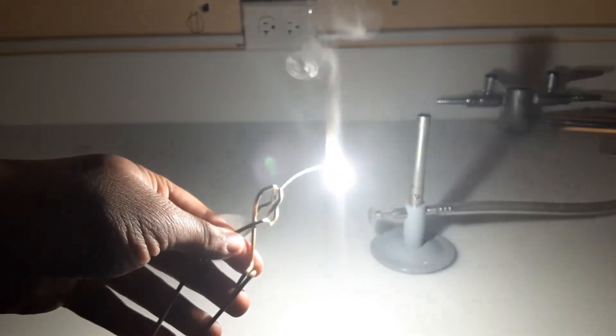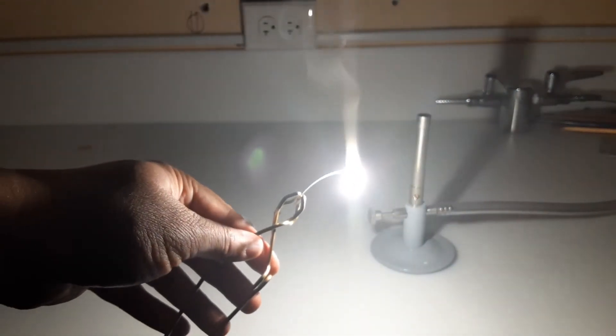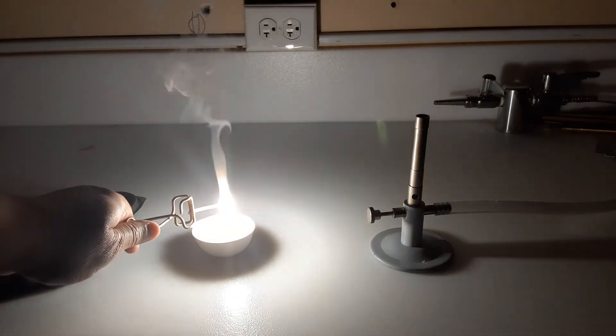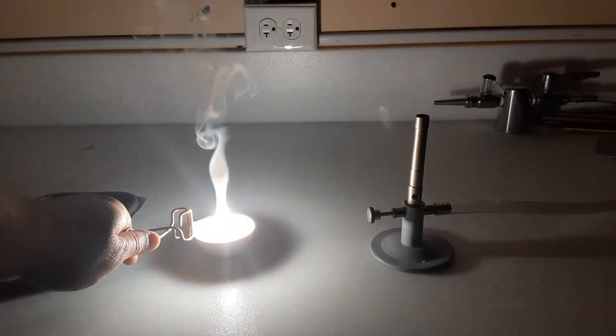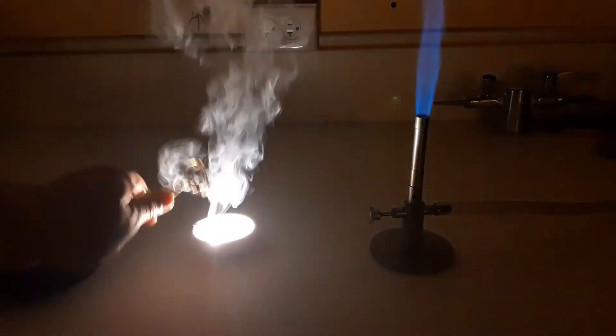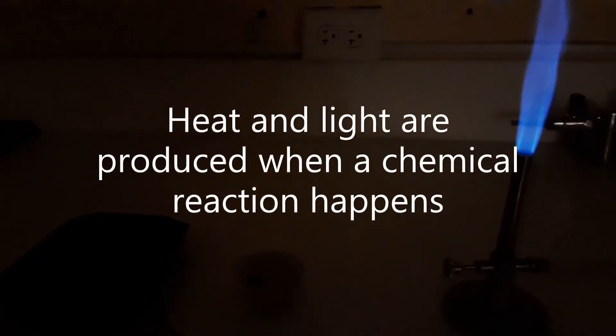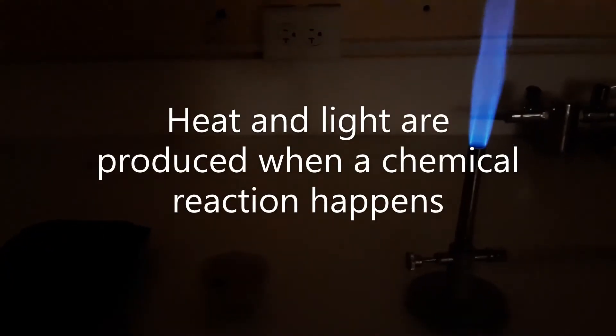You can see that the magnesium is burning with a really, really bright white light. I have a porcelain crucible here, so I'm just going to drop it into that crucible. When magnesium burns, it burns with a bright light, and that evolution of heat and light is one of the indications of a chemical reaction.